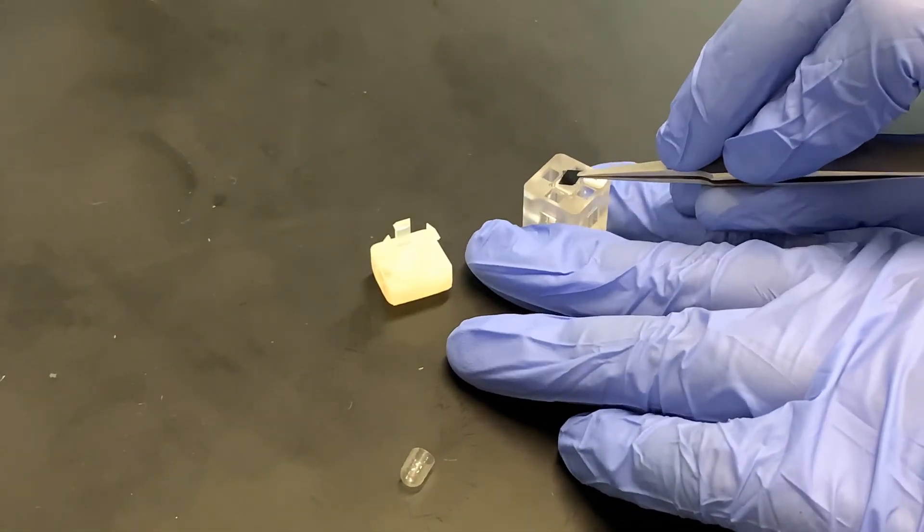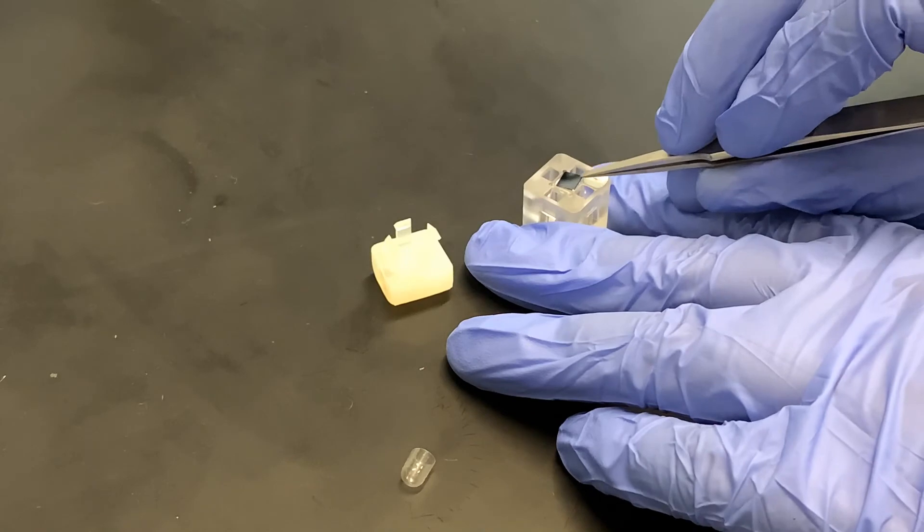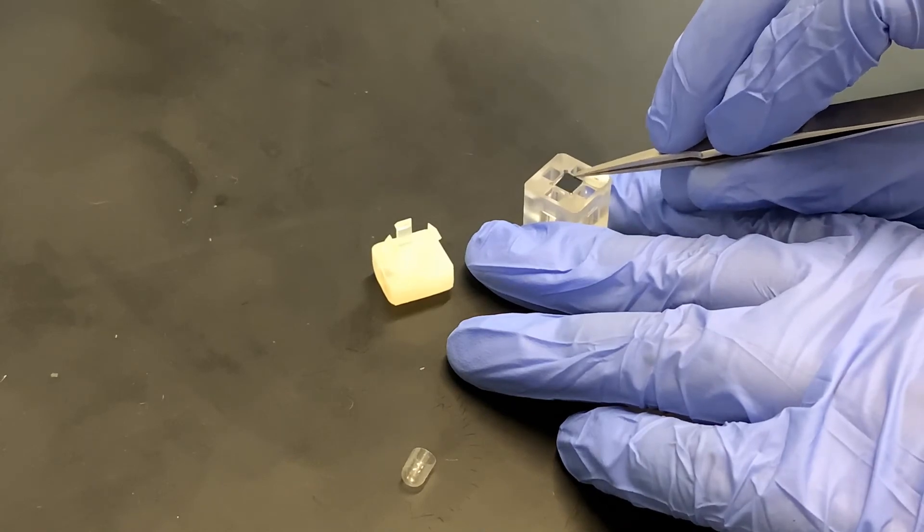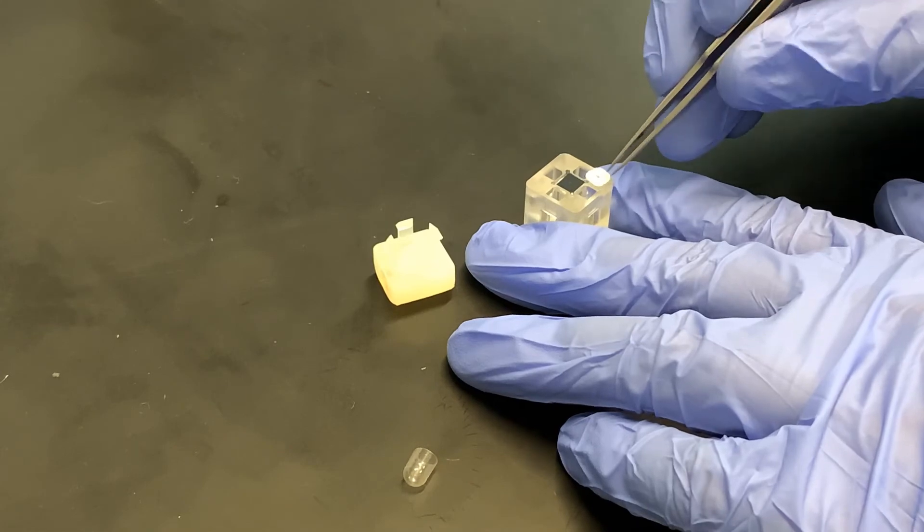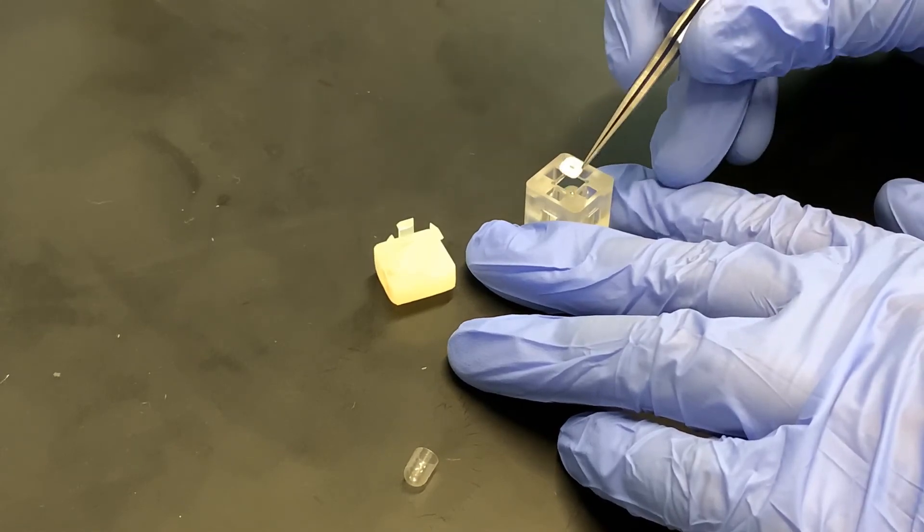Then take a second gasket and put that right on top of the chip.